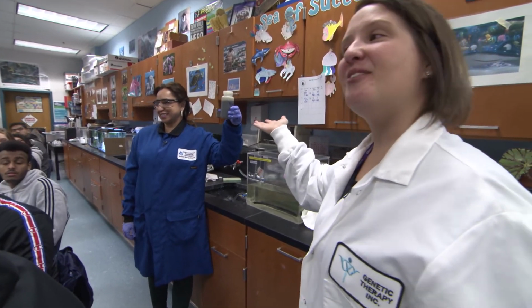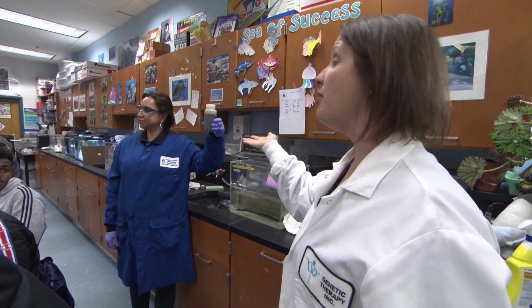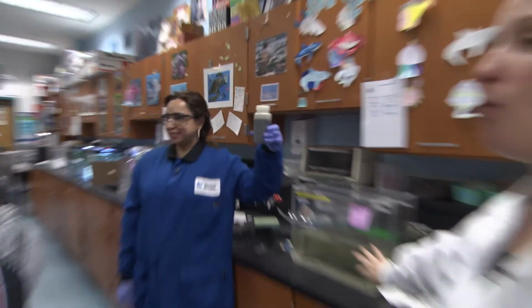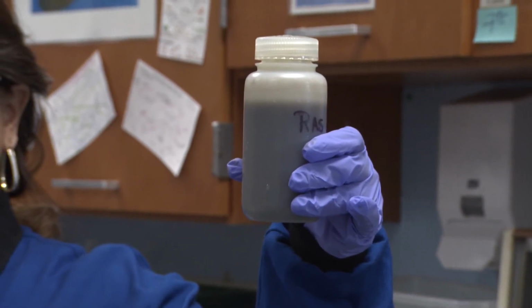Could have been any one of us in this room that contributed to the RAS sample. This is exactly what you think it is. So we are introducing microorganisms into our wastewater supply to do the work. The treatment plant should have provided you with a microorganism sample called RAS, or return activated sludge. Wearing your goggles and gloves, add about 50 mL of the RAS to the aeration tank. Allow to aerate until the next time your class meets. Helpful hint, too much RAS is not a good thing here.